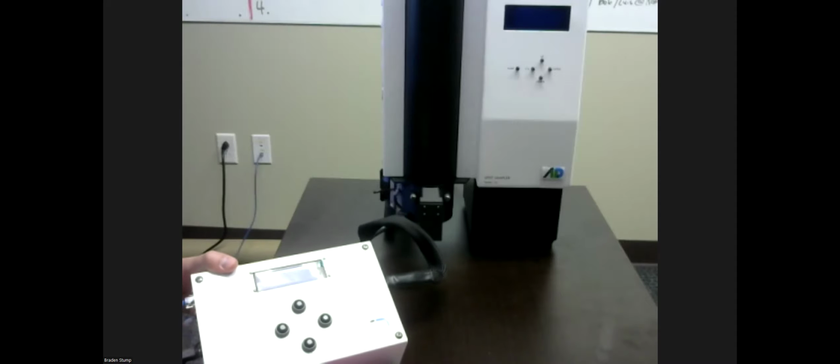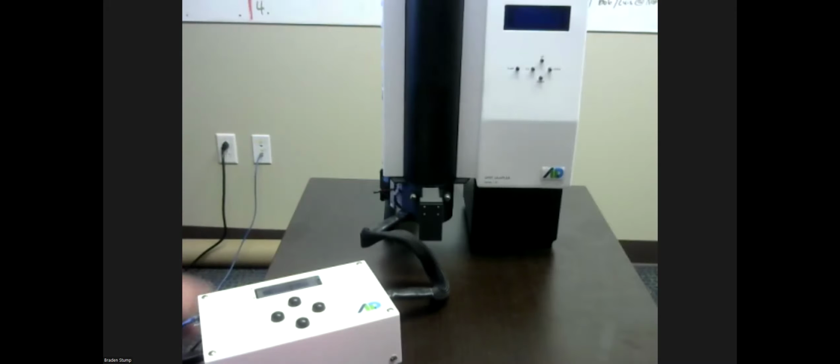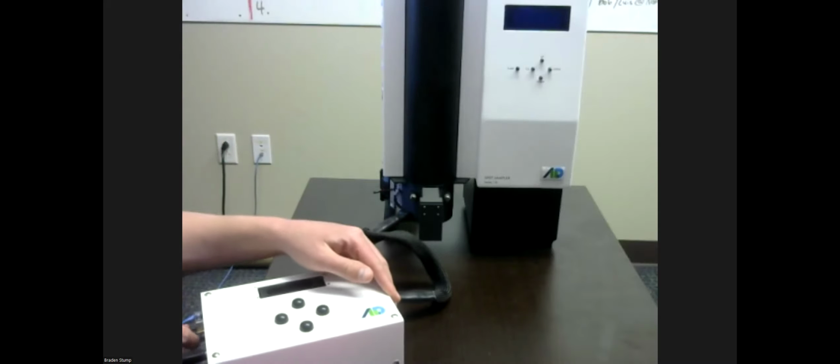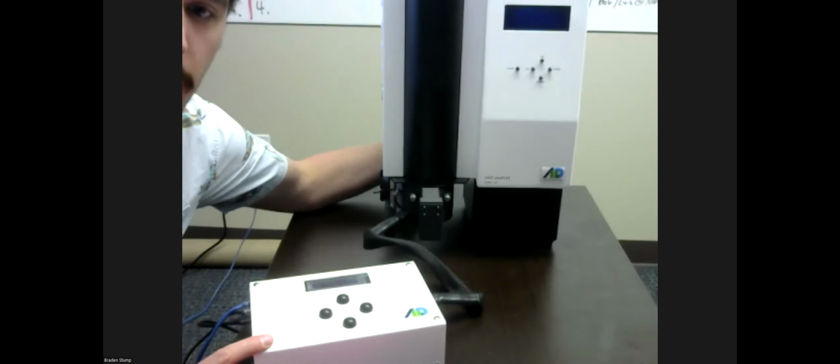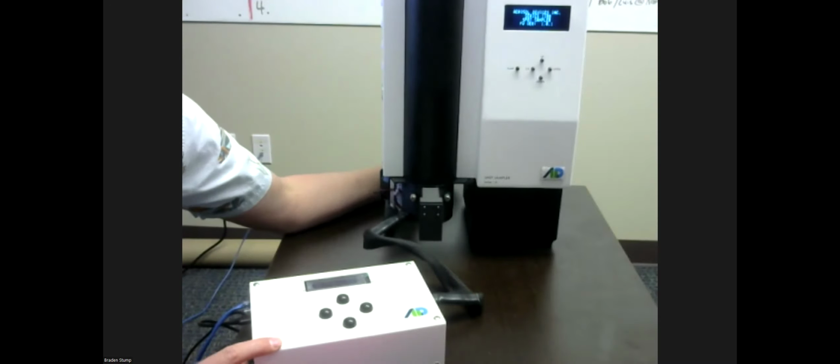Perfect. We now have all of our log files deleted off of the TLC and placed onto this USB. That is primarily useful because when you start a new sample, it will overwrite previous samples. So you definitely want to make sure to pull your log files out if you want them off of the TLC before starting a new run. Great, we're seeing that here.